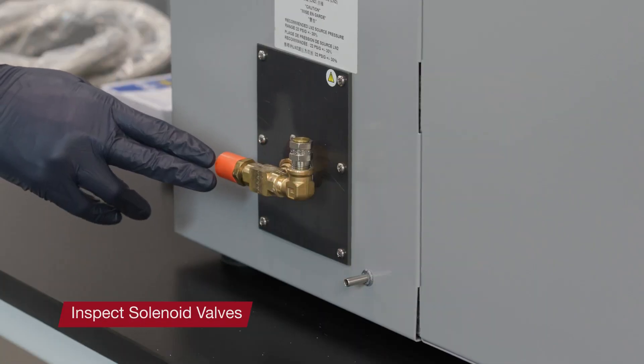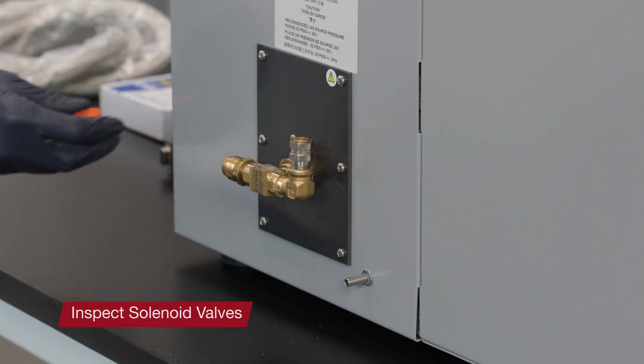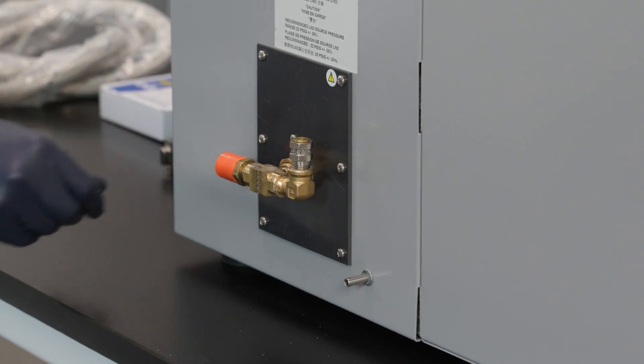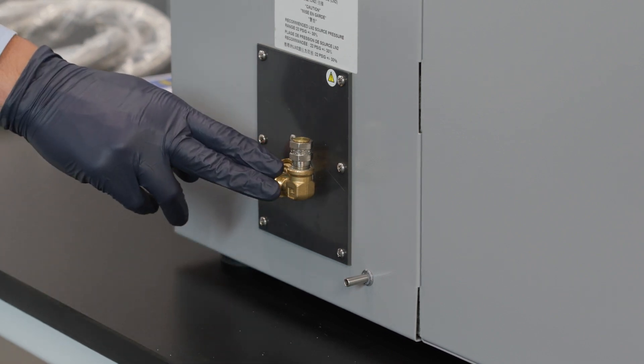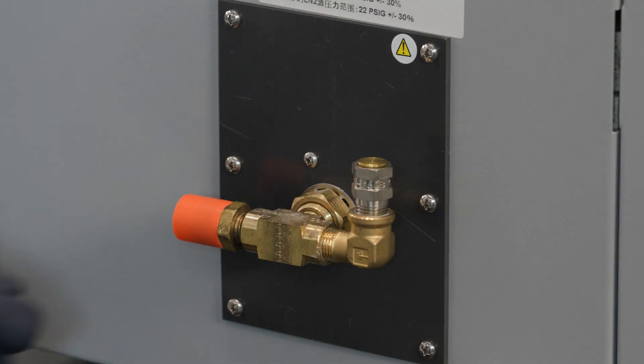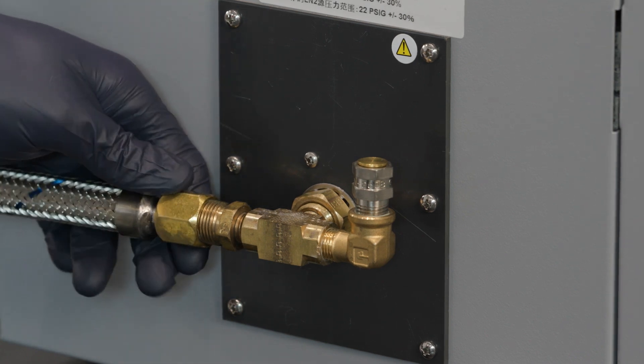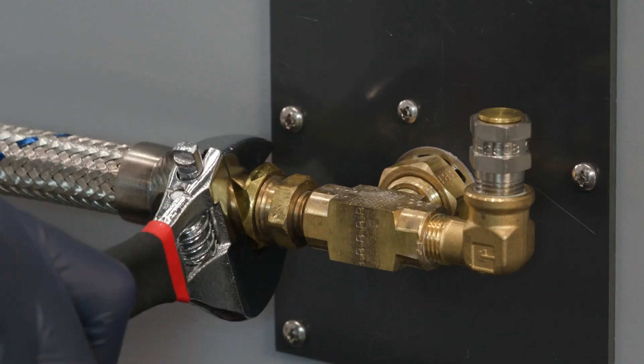In addition to monitoring the preventative maintenance indicator on the unit for the LN2 solenoid replacement, it is recommended that inspection of the solenoid valve be performed on an annual basis. The inspection and replacement should only be performed by a trained technician. We recommend contacting Thermo Scientific Technical Services if you have any questions related to the solenoid valve inspection or replacement.